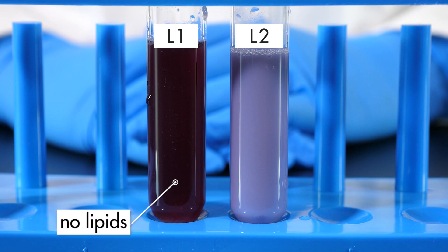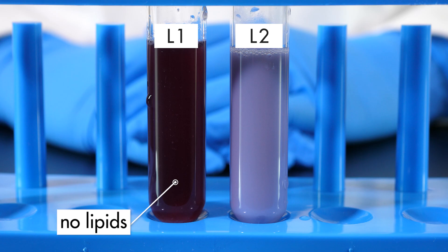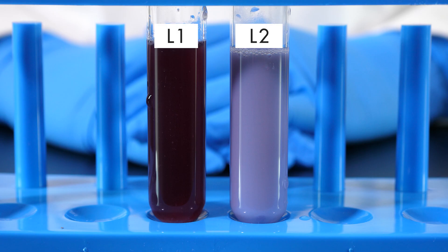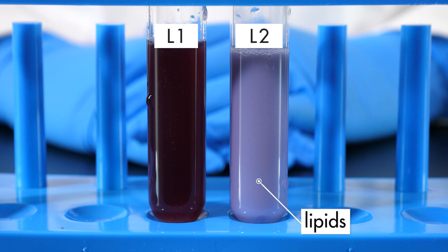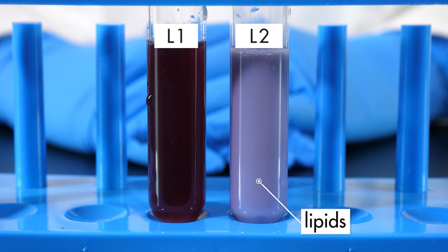This confirms that lipid digestion has taken place. The solution in test tube L2 is still light purple, indicating that lipids are still present, and no lipid digestion took place. This was the expected result, since test tube L2 was the control.